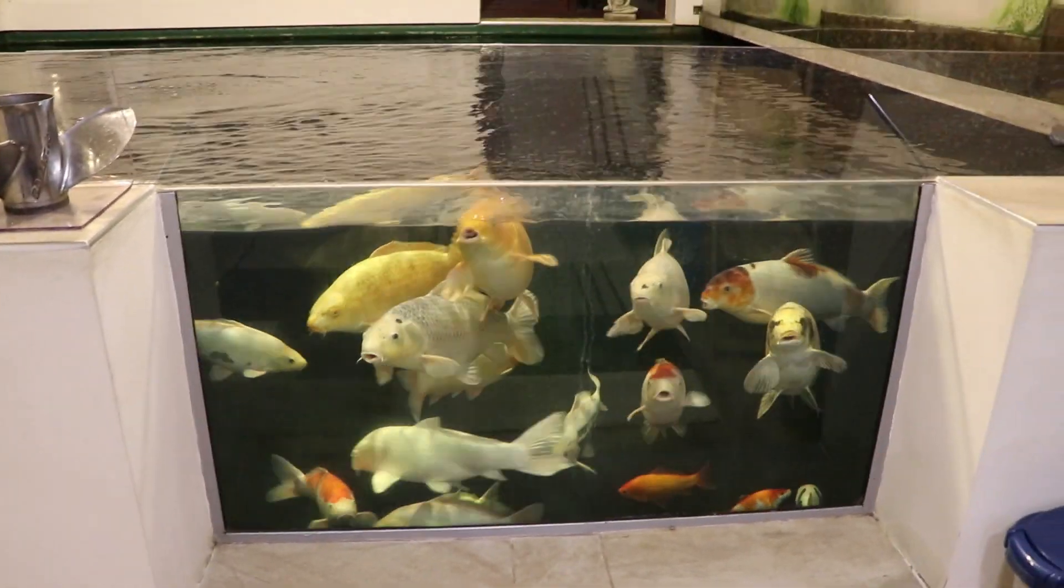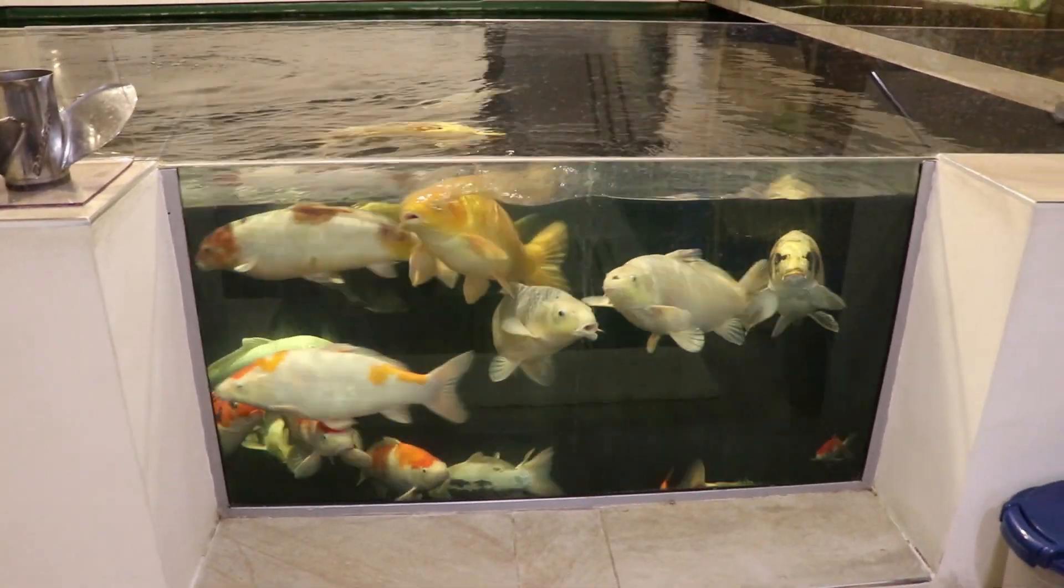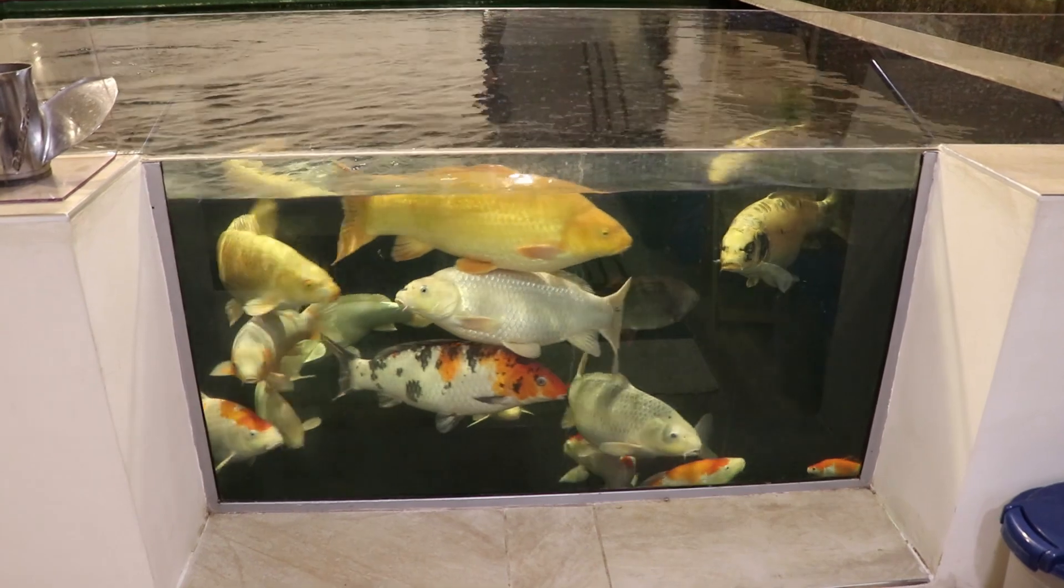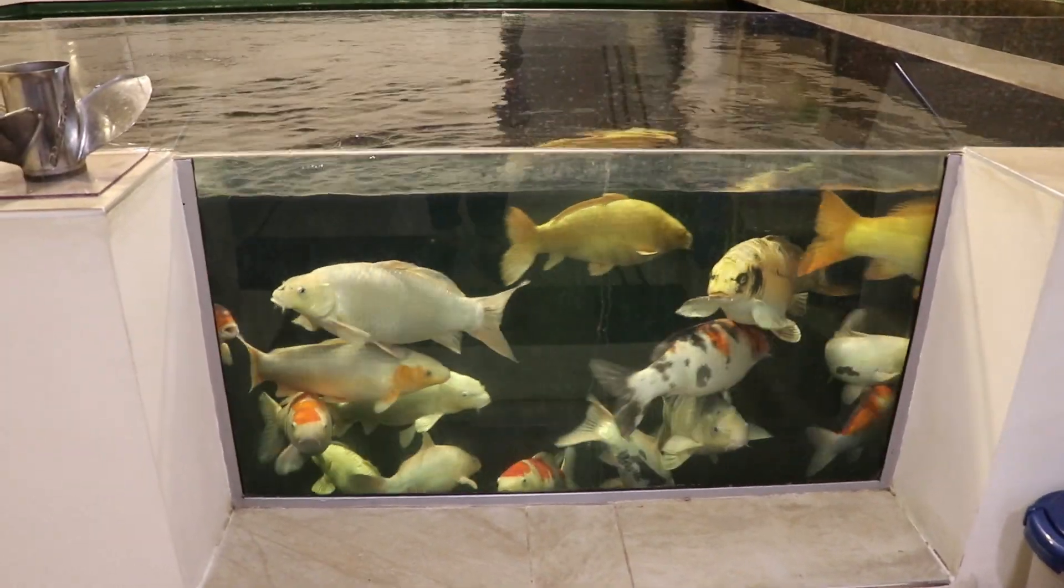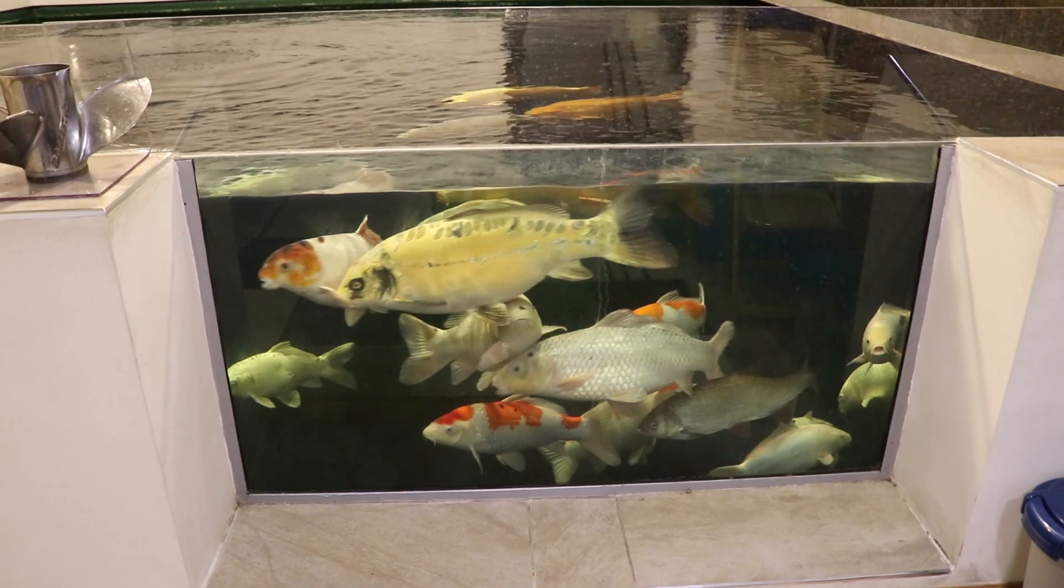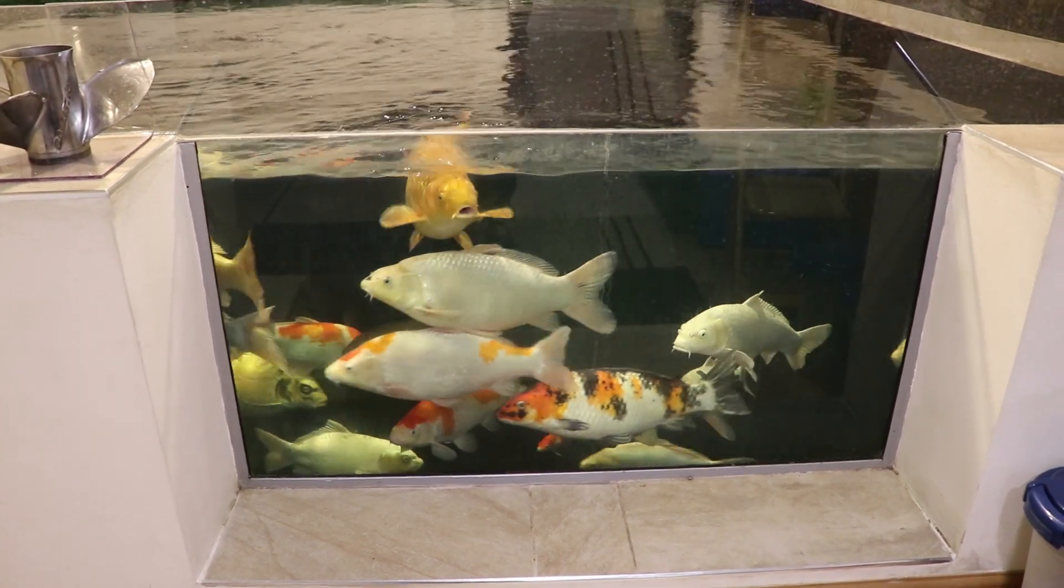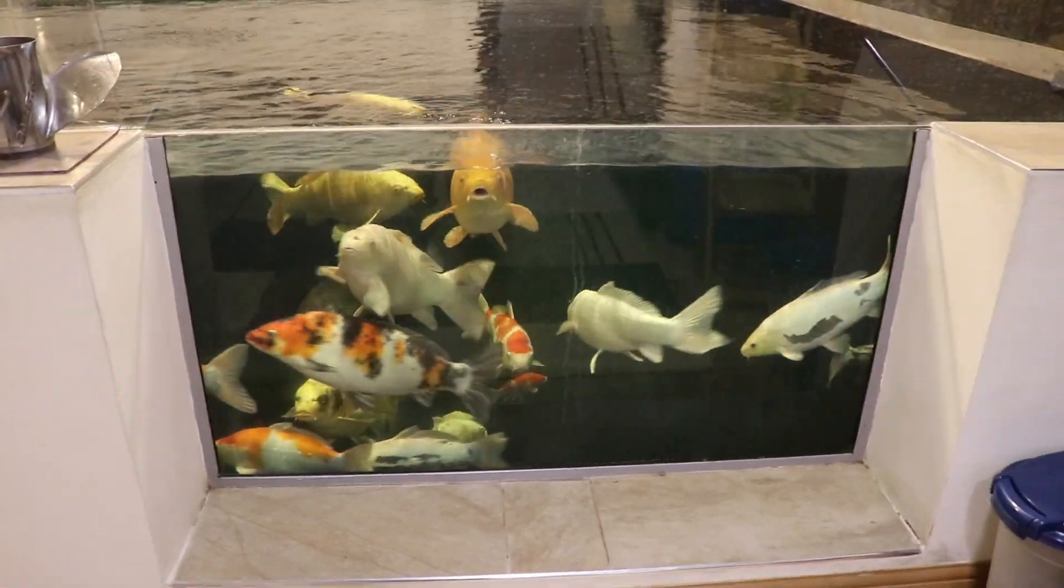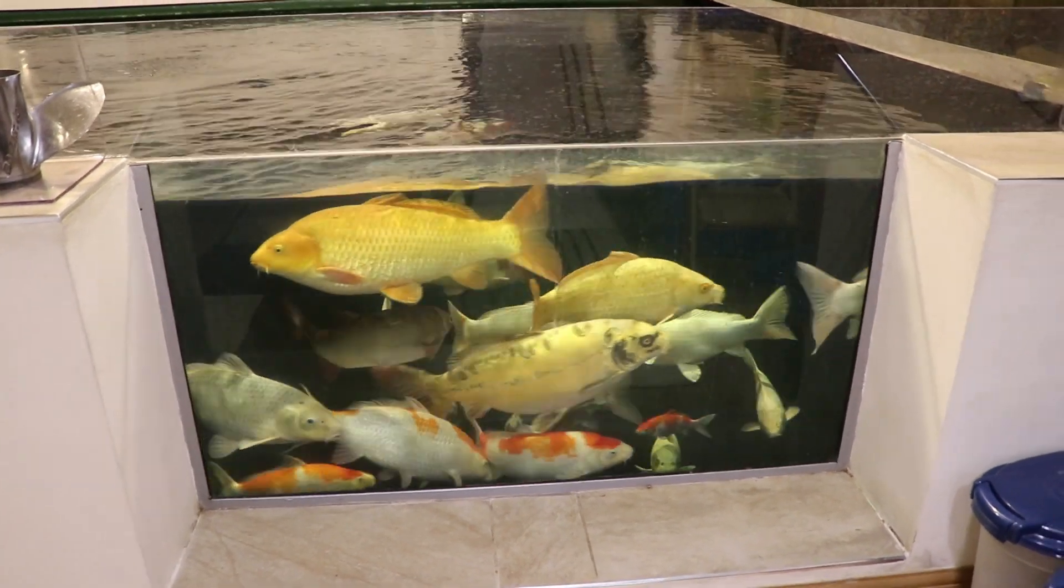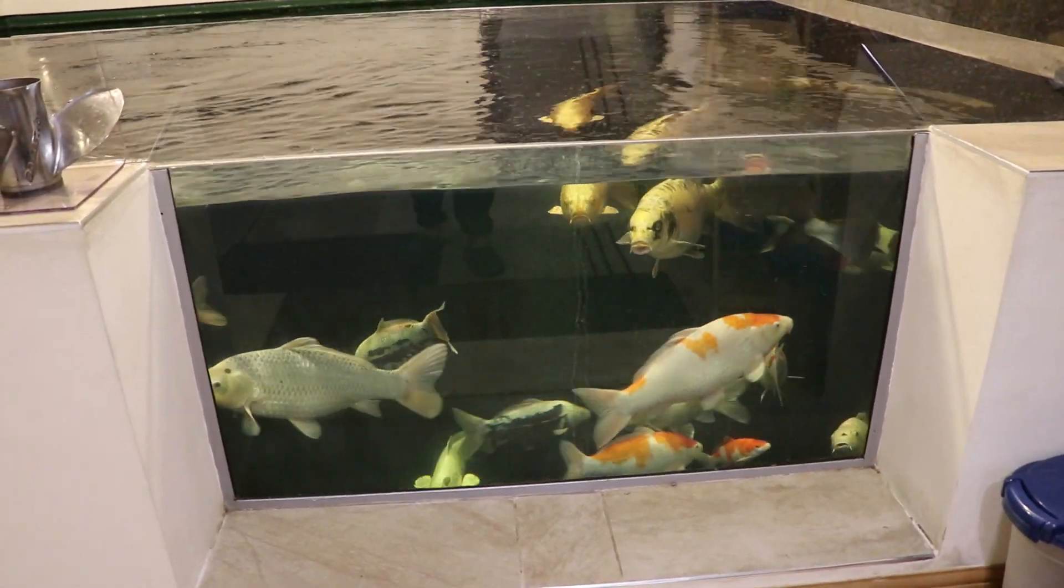Hello and welcome to my video on using a microscope. There are going to be two of these videos. This first one will show you how to actually use the microscope. The second video will show you how to use the microscope with the koi, how to scrape a koi and use the microscope then. The reason I've chosen to do this video first is because I think it's quite important to actually know how to use the microscope and how to find things before you start scraping a fish.